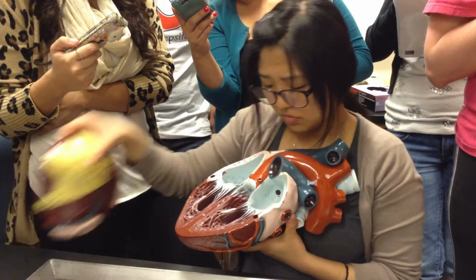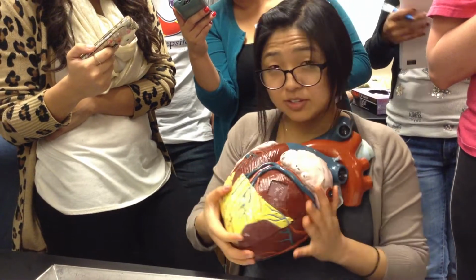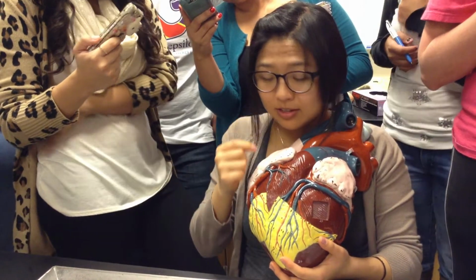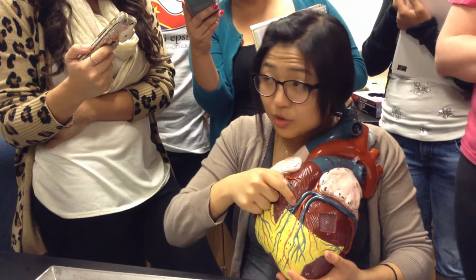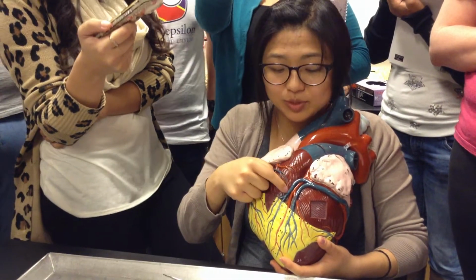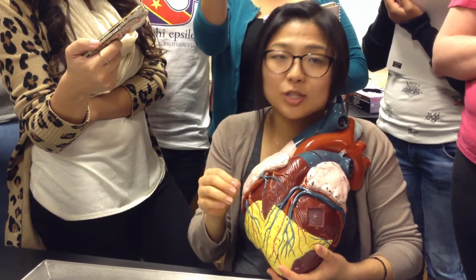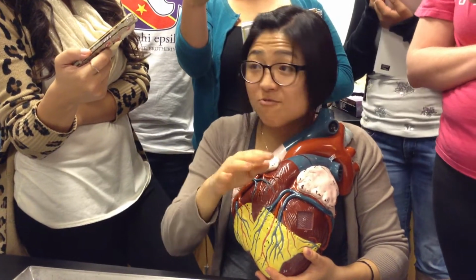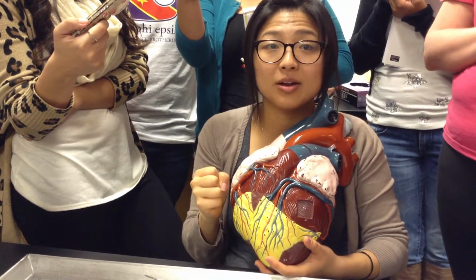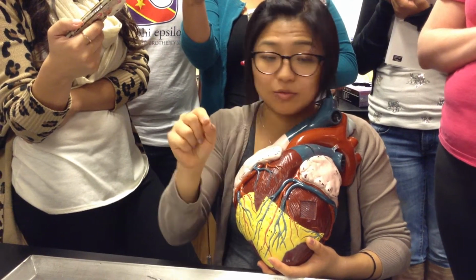On the outside, do you guys remember the blood vessels that provide to the heart itself? Right here. These are the coronary arteries and veins. I'm actually going to be a big stickler about this. On the exam, if I point to this and ask what blood vessel this is, and you just say coronary, that's not enough. That could be a vein or an artery. So don't just put coronary, don't just put phrenic. Make sure you tell me it's a nerve, this is a vein, this is an artery. I'm going to make a very big deal about it. If you don't put that, it will be wrong.